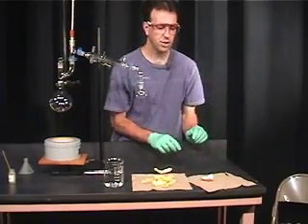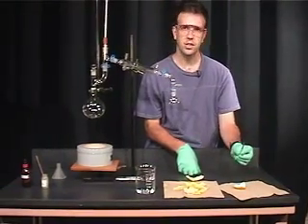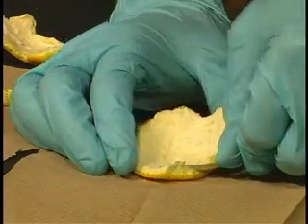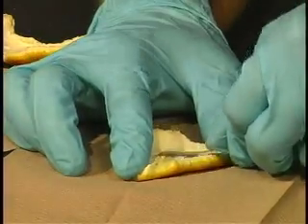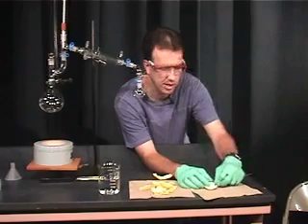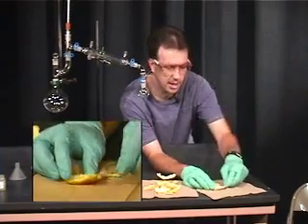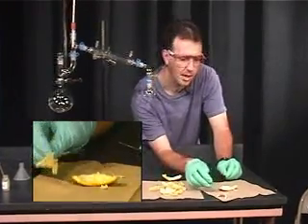I'm going to show you how to remove the white pith using a spatula. Initially there's going to be quite a bit, so you want to put your spatula on the orange peel so that it runs parallel to the orange peel and just simply start scraping underneath. You don't want to push too hard because you'll start to break the orange. Initially you'll get quite a large piece of pith coming off.